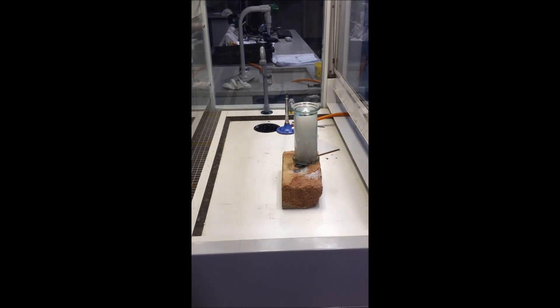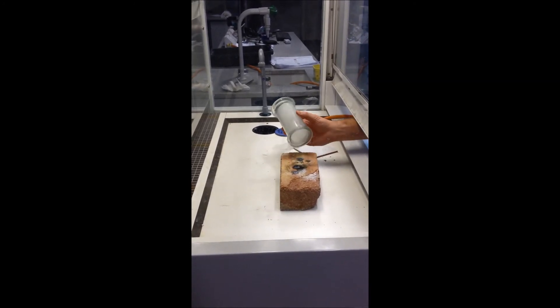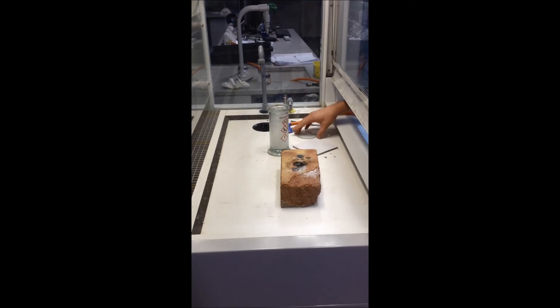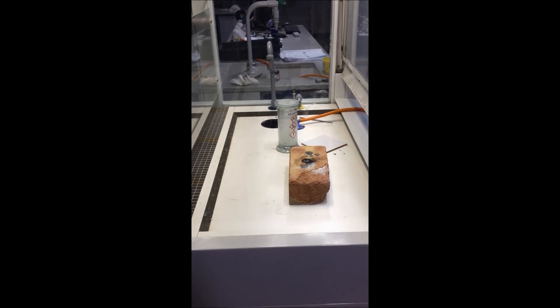Once it's finished, you can see our white solid, which is our sodium chloride. Just like that.